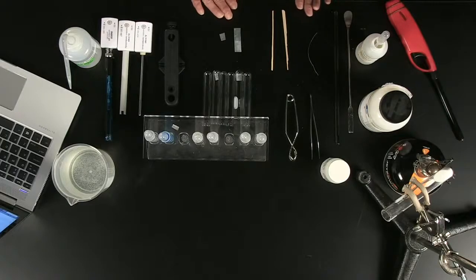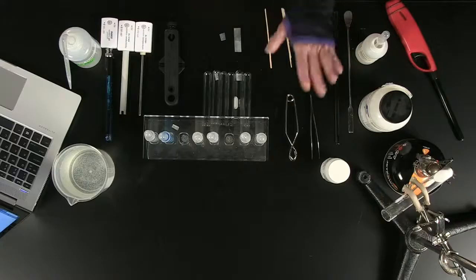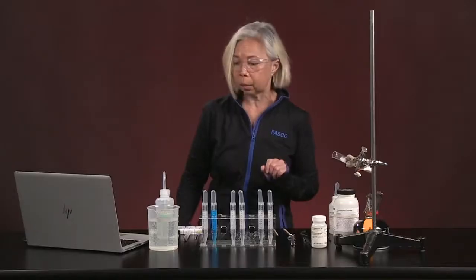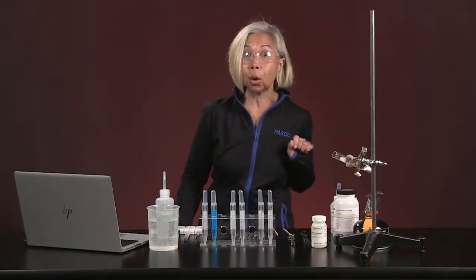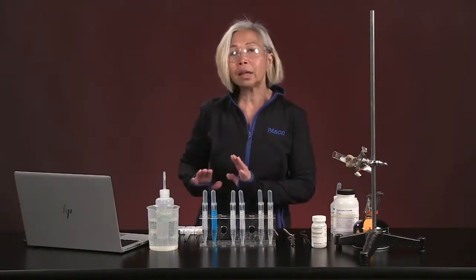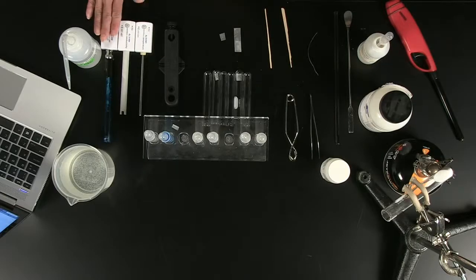We have samples of metals. We have zinc as well as magnesium. We're going to need these wood splints because, yes, there's a little fire involved here. We have test tube holders as well as a pair of tweezers just to handle our material safely. We have a sample of phenolphthalein. This is a 0.5% solution of phenolphthalein with its own dropper. And as far as sensors are concerned, we're going to be doing a quantitative measurement in the second portion of this series. And we have here a wireless pH sensor, a wireless conductivity sensor, and a wireless temperature sensor.